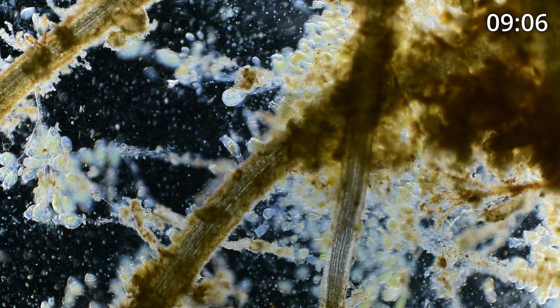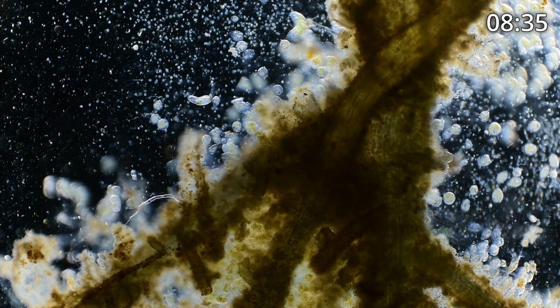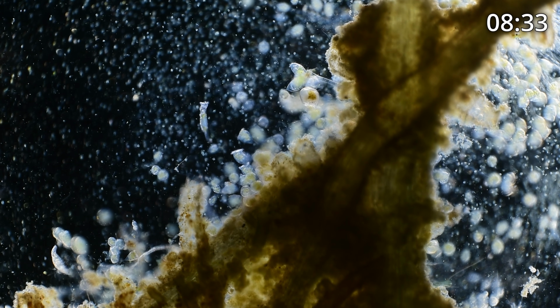On the other hand, if you look at this huge mass of peritrichs that are kind of golden and white in the middle now, these seem to be more of the non-colonial independent type, probably vorticella or something similar. Each stalk is attached to the branch on its own, and while they might get twisted and tangled, they're still non-colonial. We see a lot of rotifers that have eggs attached to them.